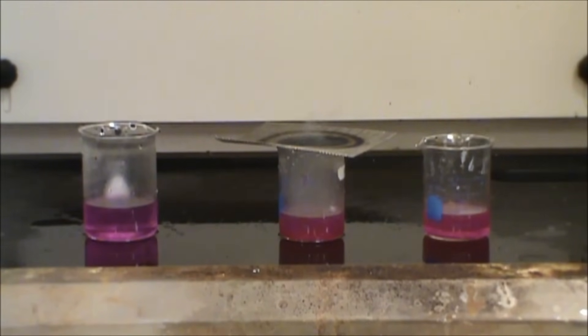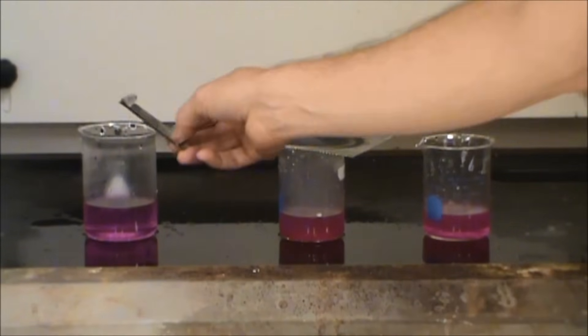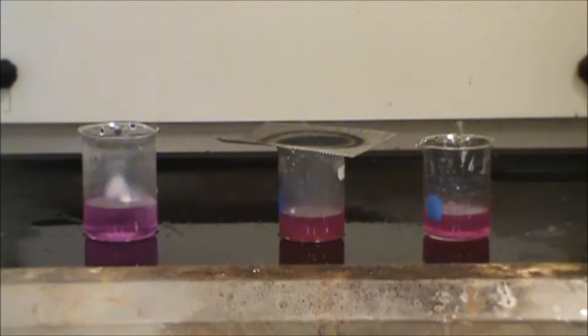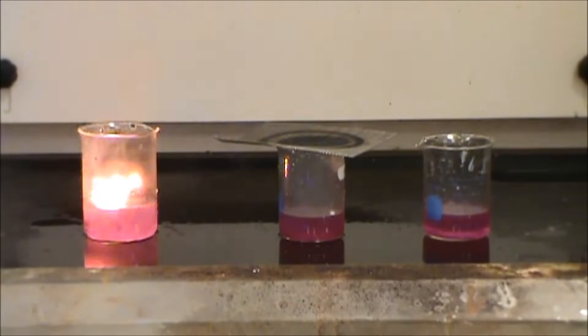Now that potassium there was quite reactive, but the sodium sometimes will allow hydrogen gas to build up. In this case it's not igniting. We can try adding another piece here. We can hope that's going to send off some shrapnel and some flame.